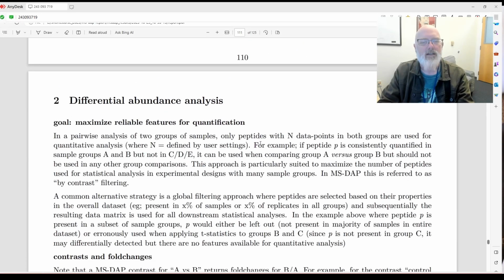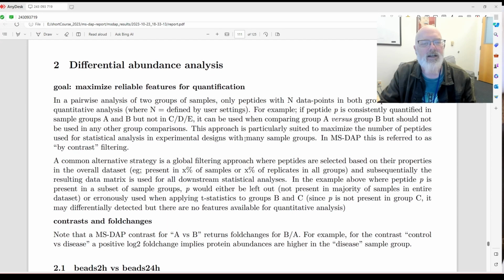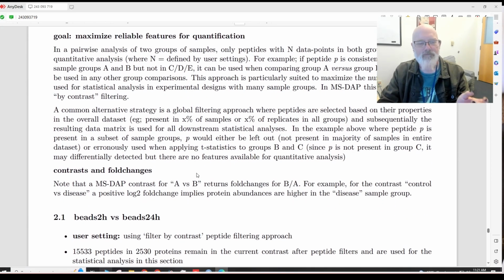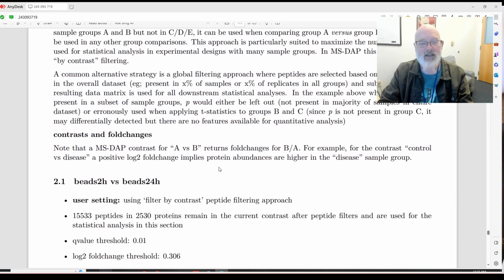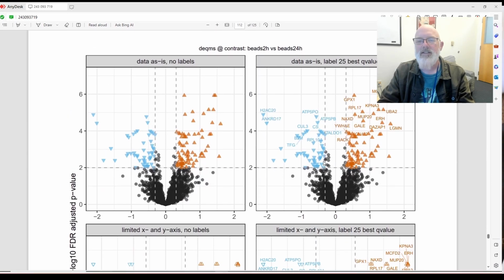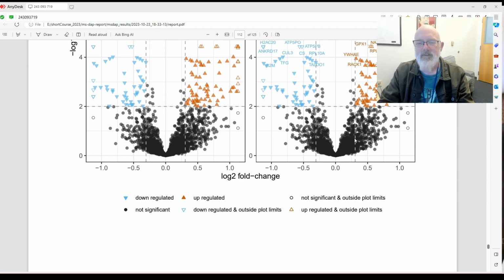Differential abundance analyses. I was referred to as contrast. So we could do different contrasts. We just did beads 2 to 24 hours, but we could do S-trap versus urea, or S-trap versus beads 2 hours and 24 hours, which is kind of cool. Here are the volcano plots. That's kind of neat. I really like that.